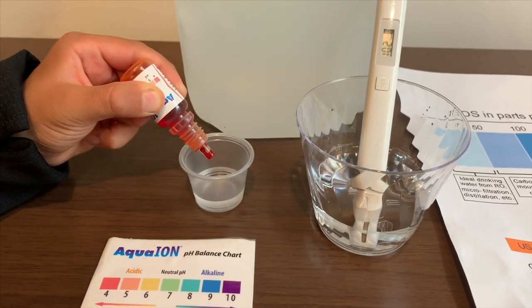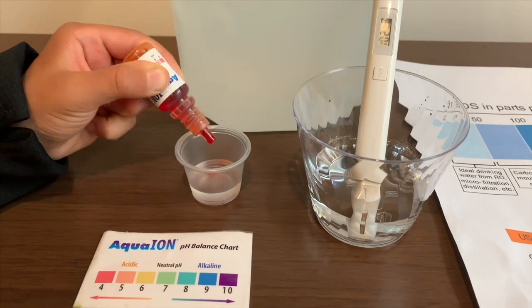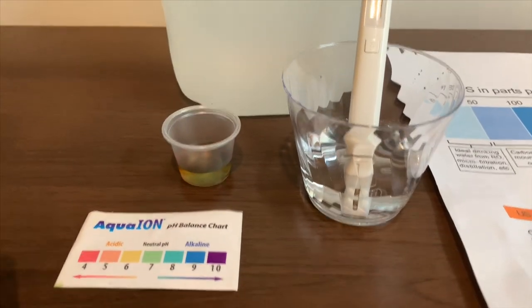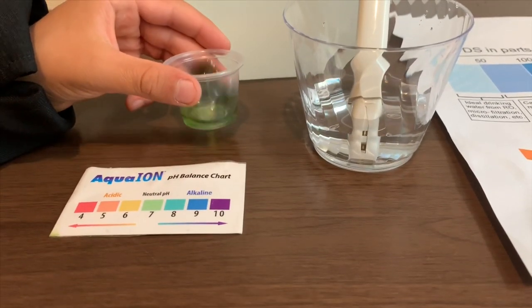Only do two drops. Let's stir it a little for a better result.